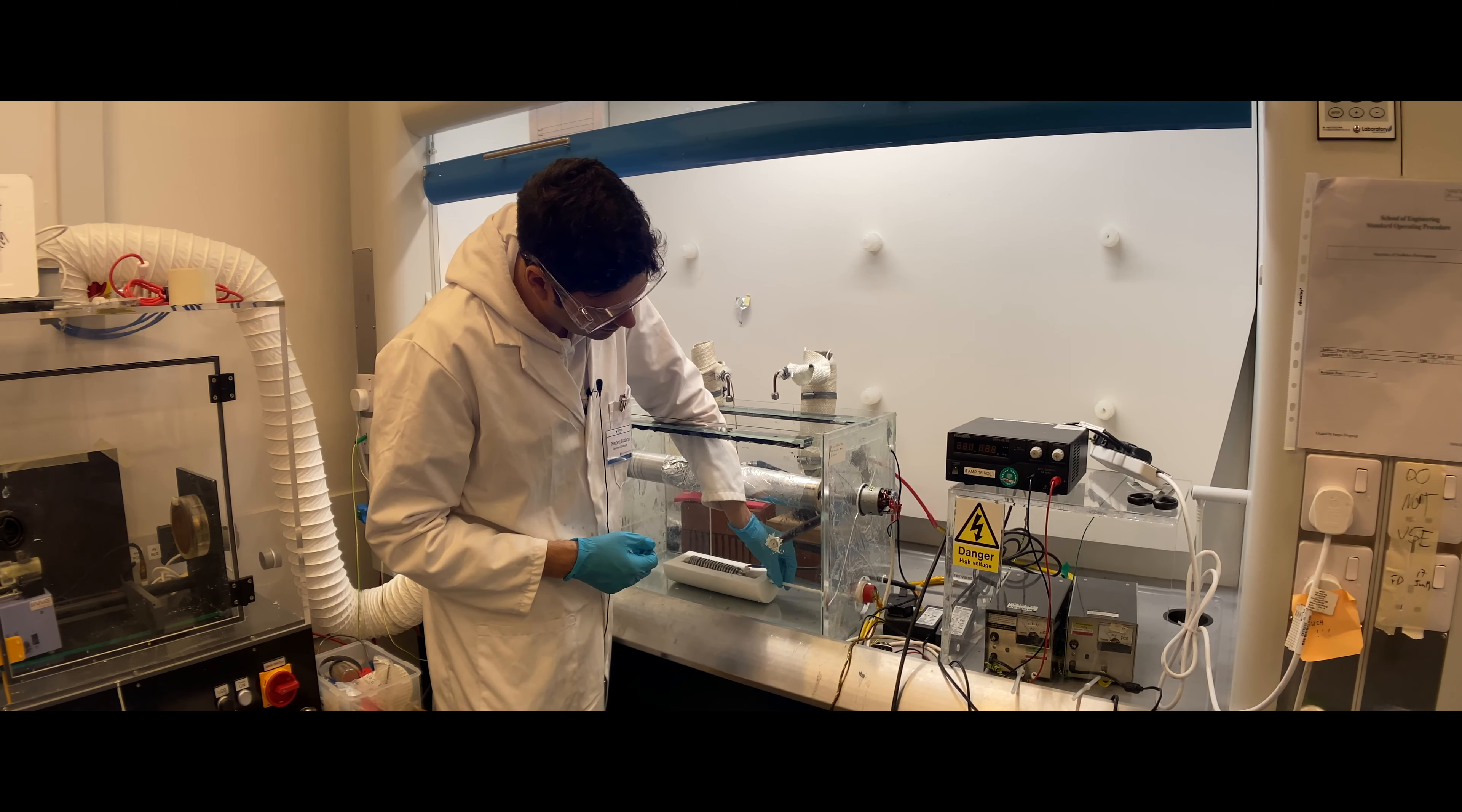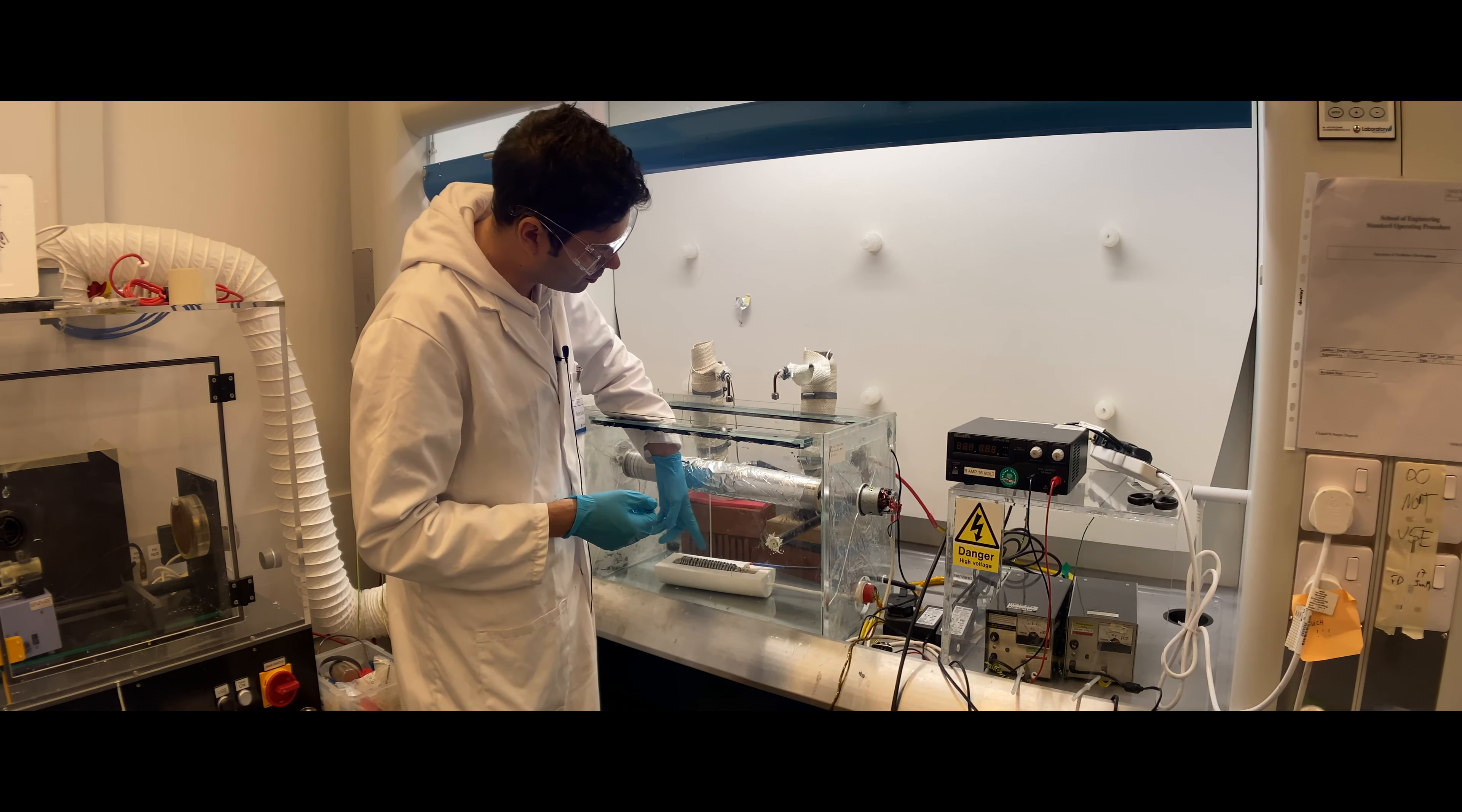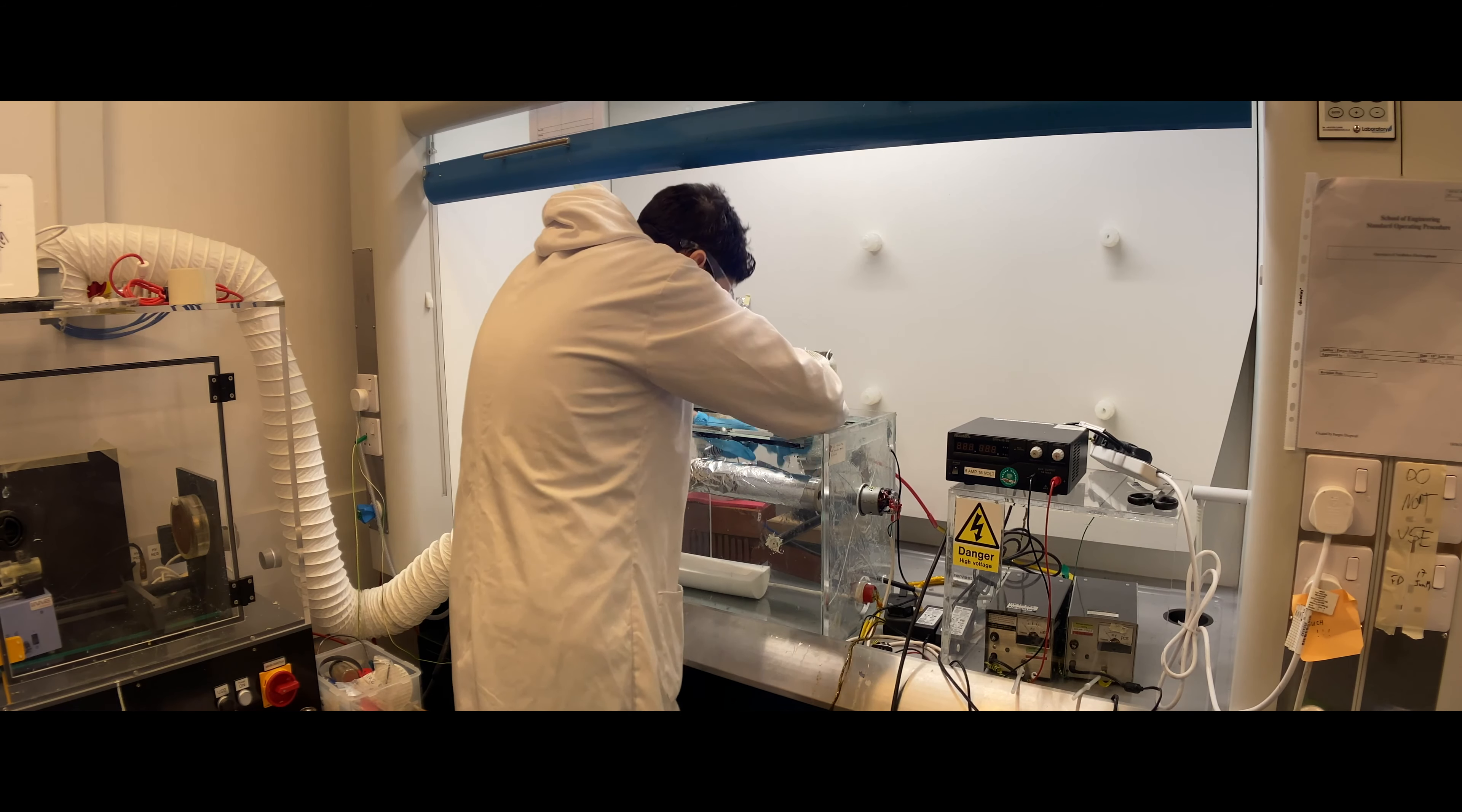Then you put your hand and grab the Teflon rod, while with some of your fingers you pull out the Teflon bath from the Teflon rod. You might need to also adjust the high voltage cable. Do it very slowly and make sure you don't break the high voltage cable. Then you'll need both hands to grab the high voltage coil electrode, take the PEEK coupler off, and pull off the high voltage cable. I usually rotate the PEEK coupler counter-clockwise to remove it. Then I remove the leftover parafilm, and you can simply sleeve off the loop from this.